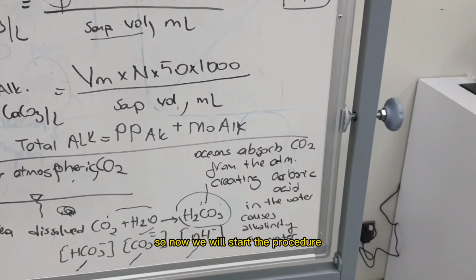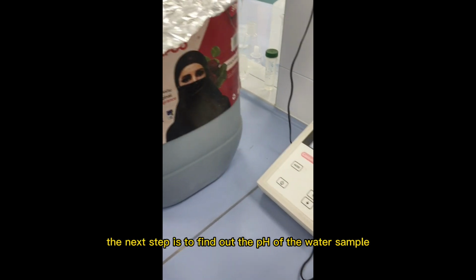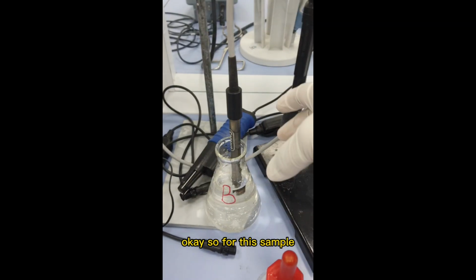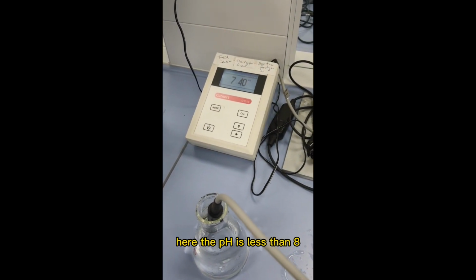So now we will start the procedure. This was the explanation of the theory. Now the next step is to find out the pH of the water sample. You can see here the pH is more than 8, so for this sample we have to add the phenolphthalein indicator. Similarly, for the second sample, here the pH is less than 8.